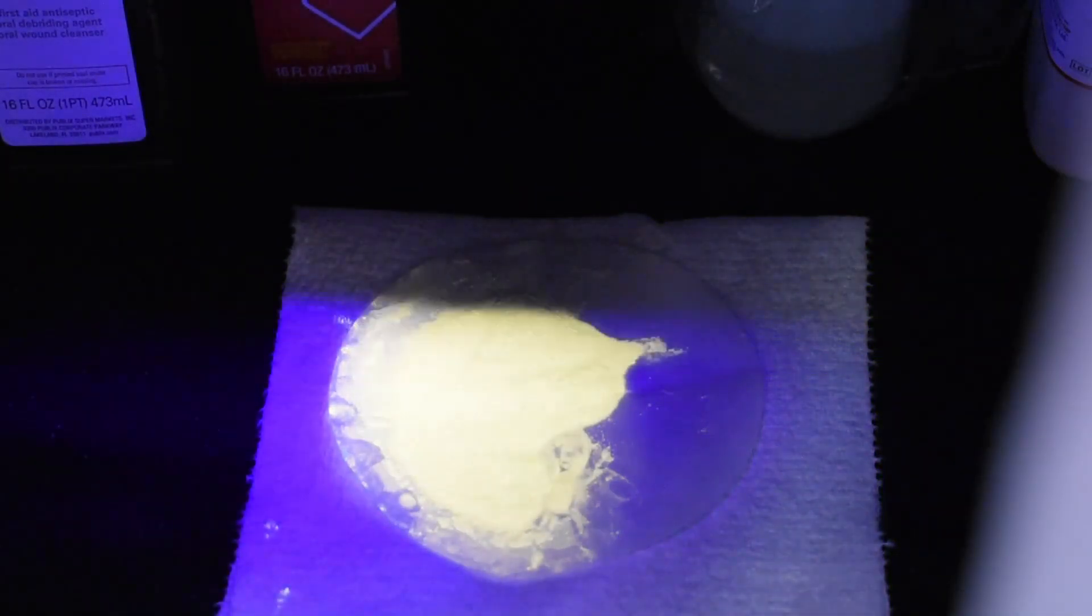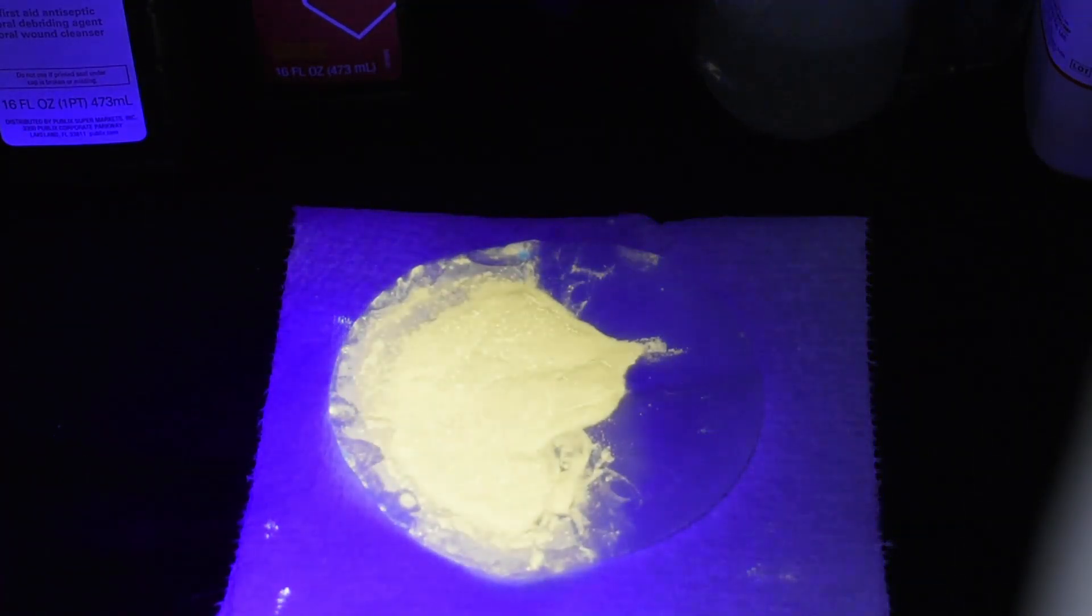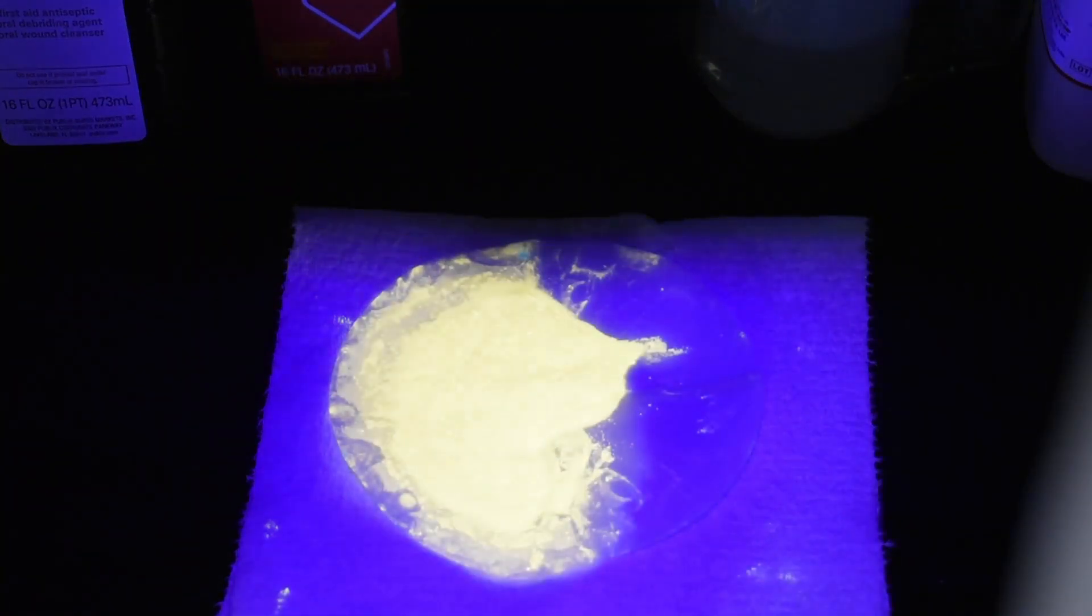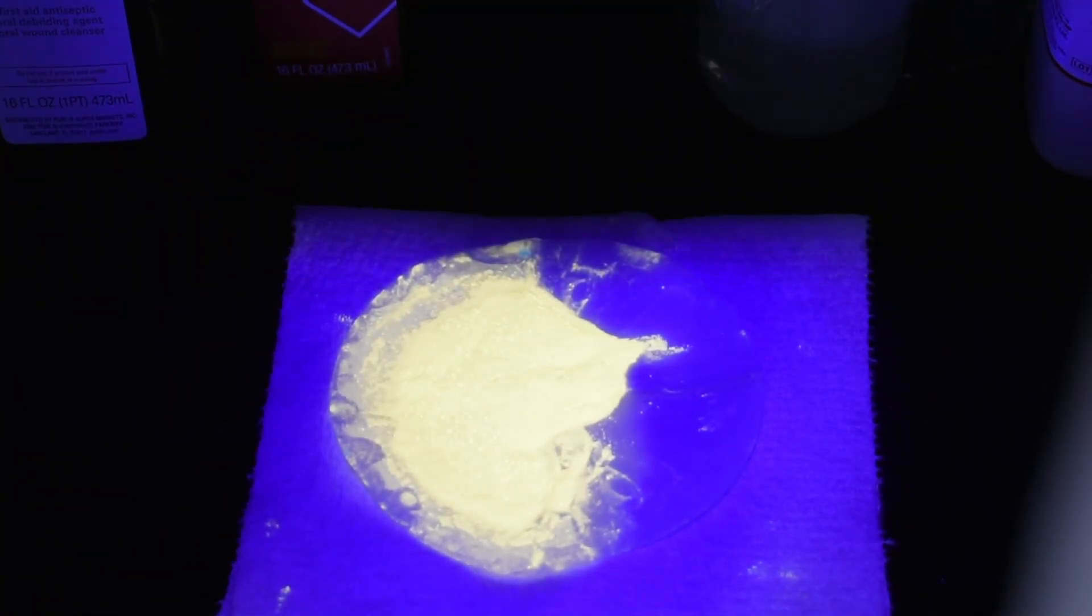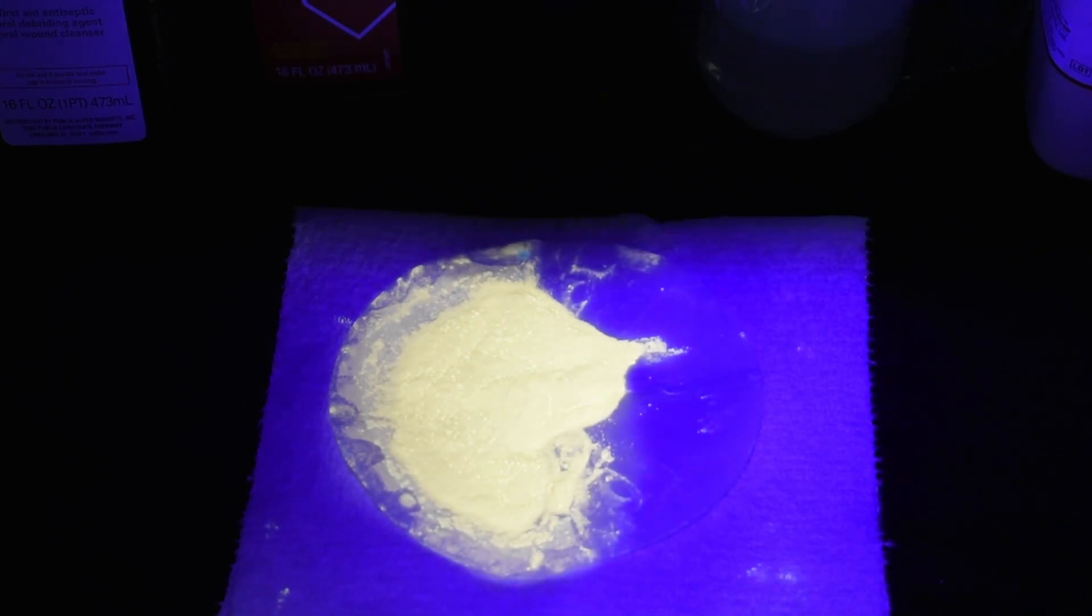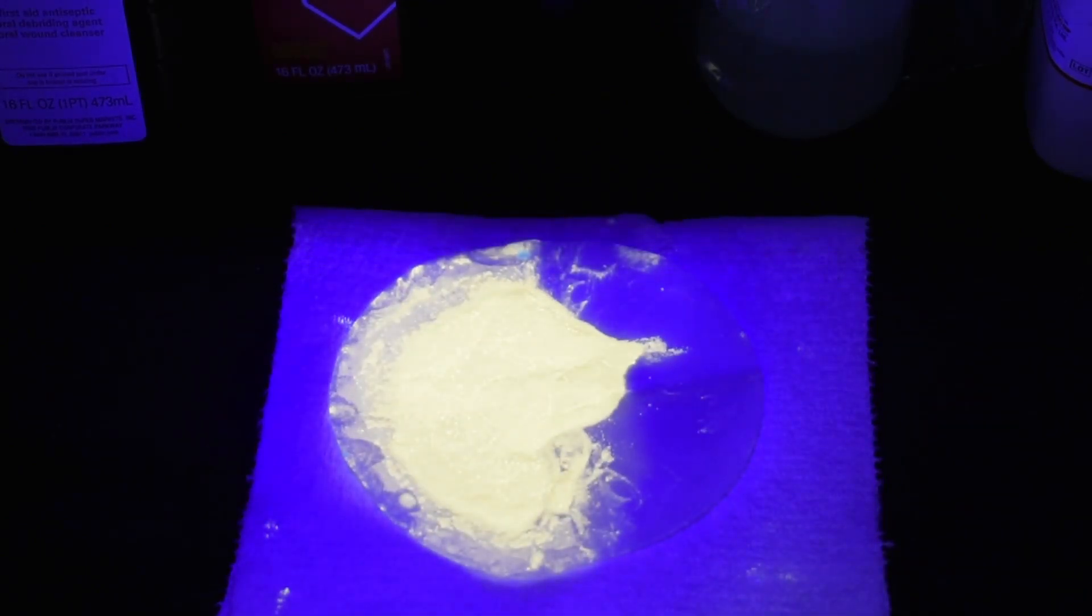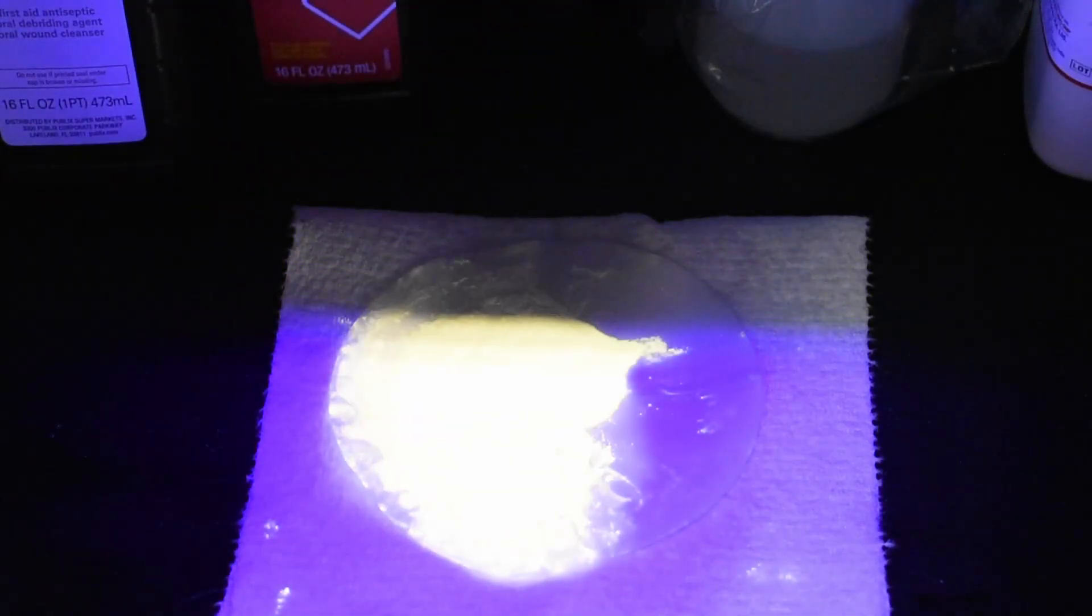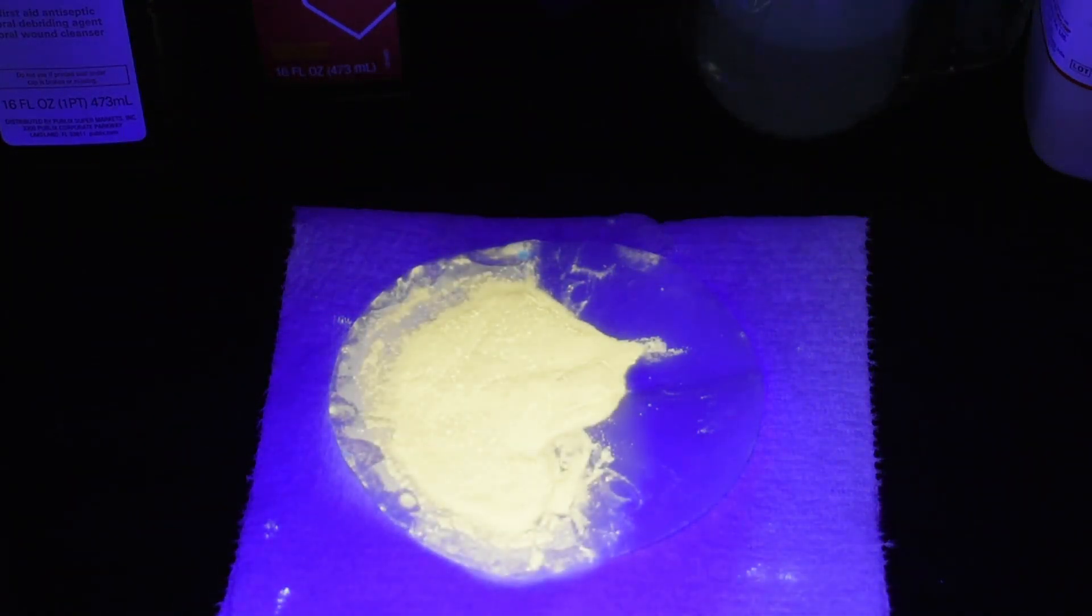Wow. That's more than I thought. The camera can't really capture it well. It's a very nice yellow color. It definitely fluoresces. That's nice. So here is it without the fluorescence, and here is with. You can see it's a real nice yellow.